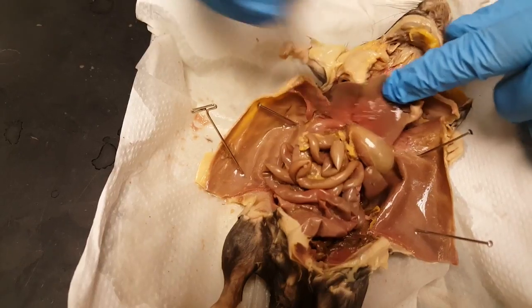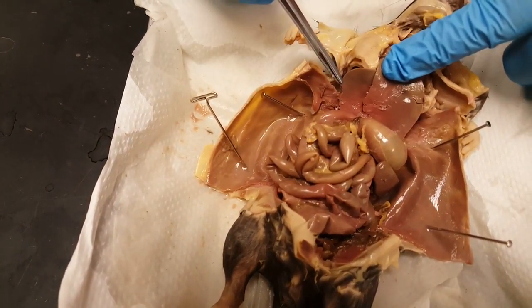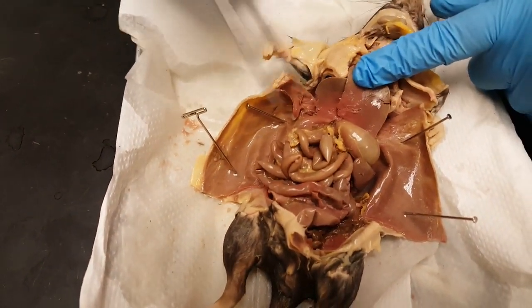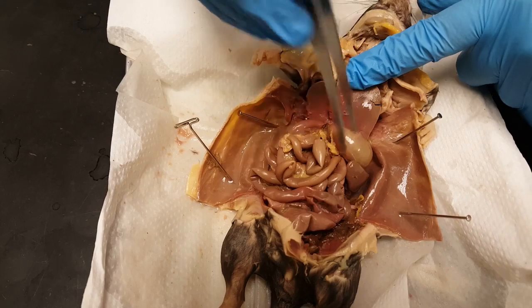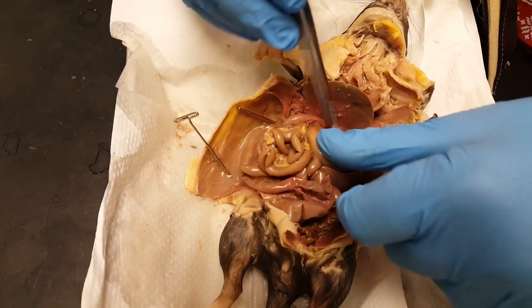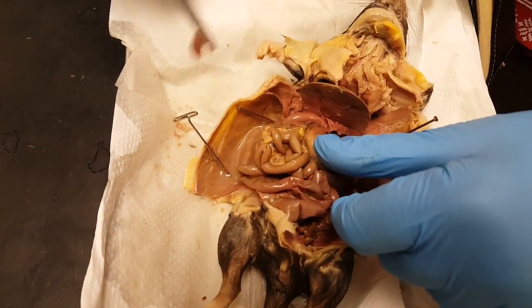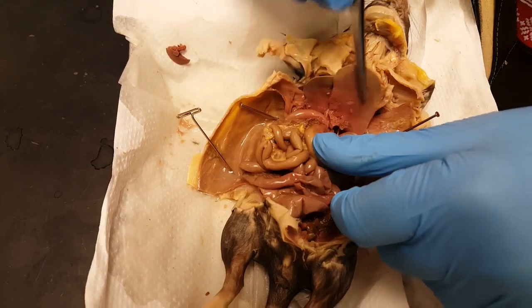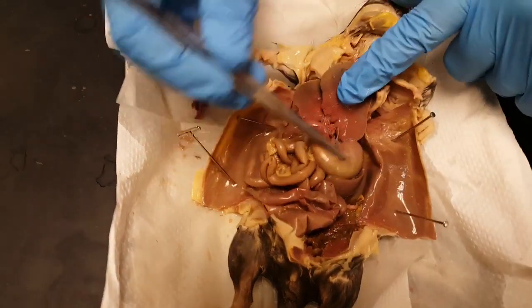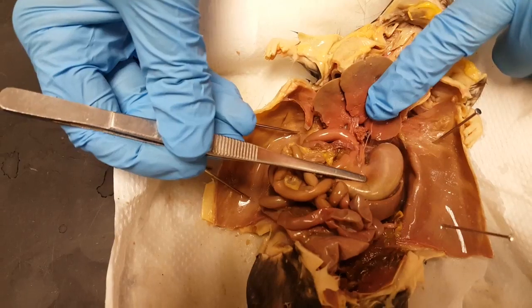If we lift the liver up, you'll notice there is no gallbladder. There's a gallbladder in humans, but not in rats. And this pouch structure here is the stomach. You can see from this angle, the esophagus enters the stomach right there.